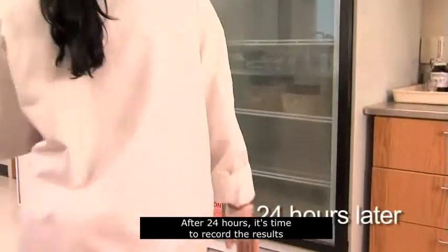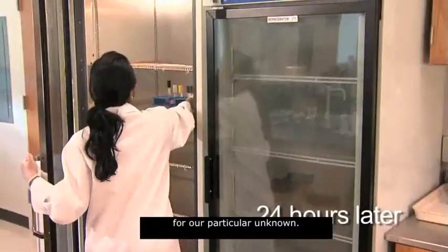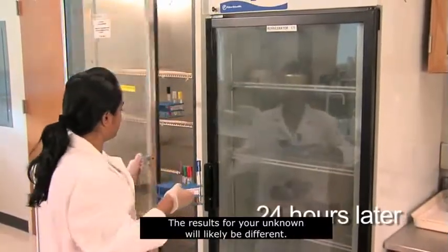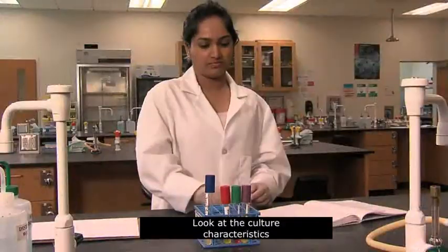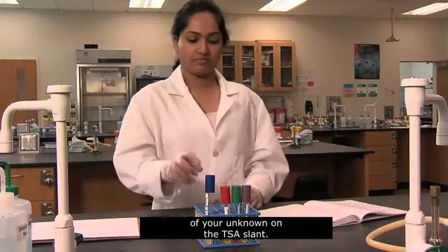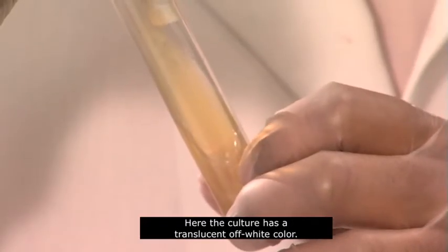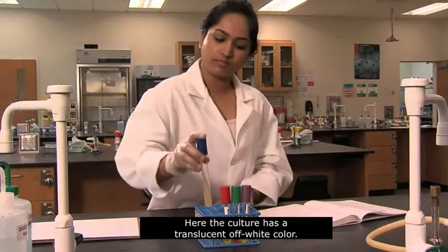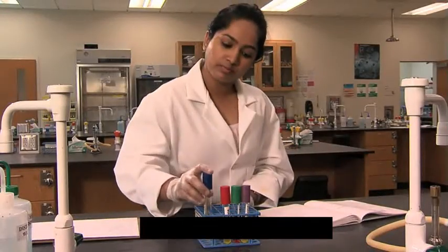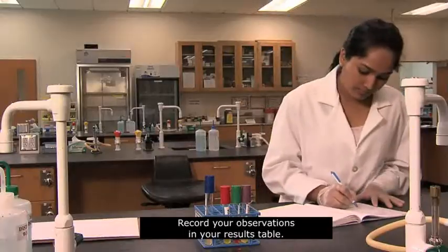After 24 hours, it's time to record the results for our particular unknown. The results for your unknown will likely be different. Look at the culture characteristics of your unknown on the TSA slant. Here, the culture has a translucent, off-white color. Record your observations in your results table.